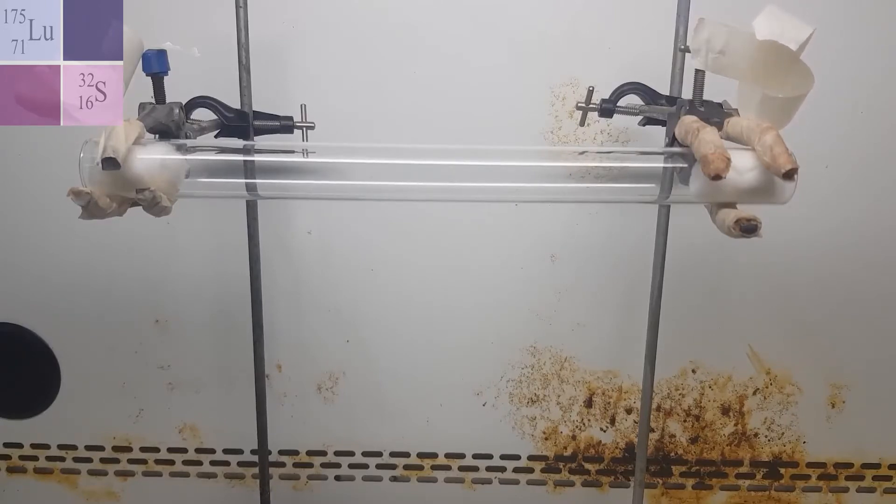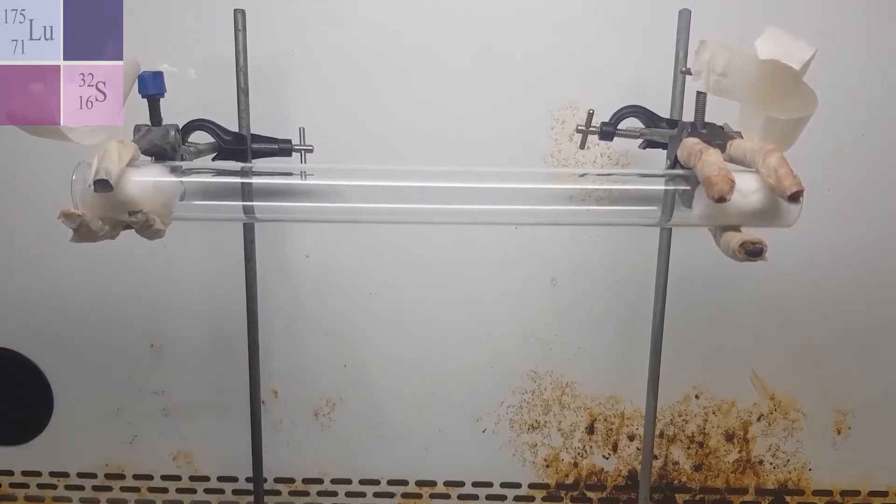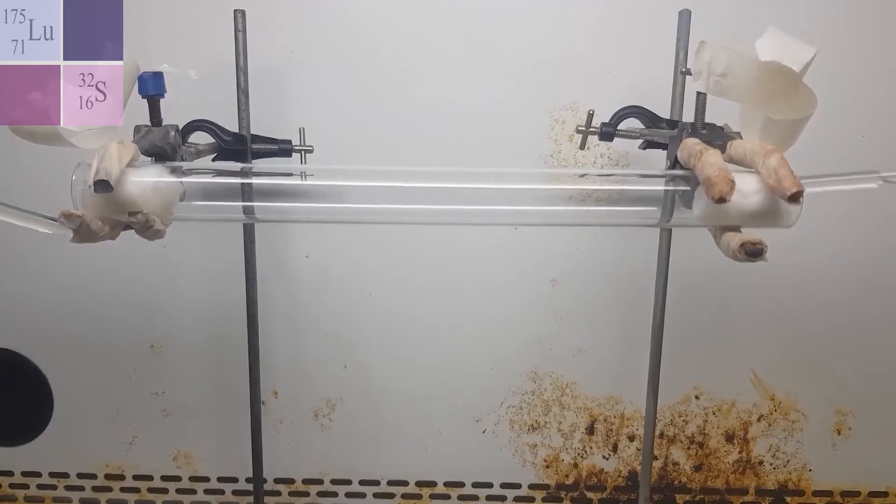Now, ideally, I should have stoppers to stopper the ends of my glass tube here, but I don't. So I'm hoping that these pieces of tape will help with that. Alright, so let's get started. Let's try to race these two gases together. Alright, let's see what happens.